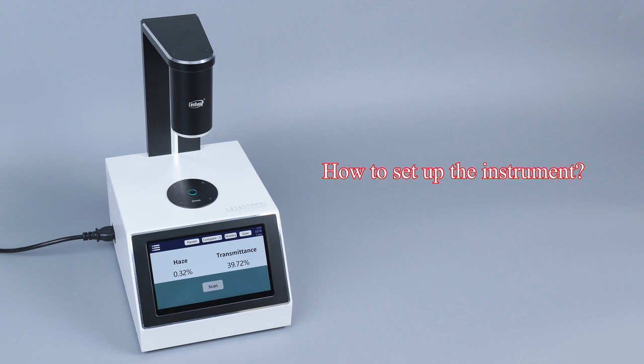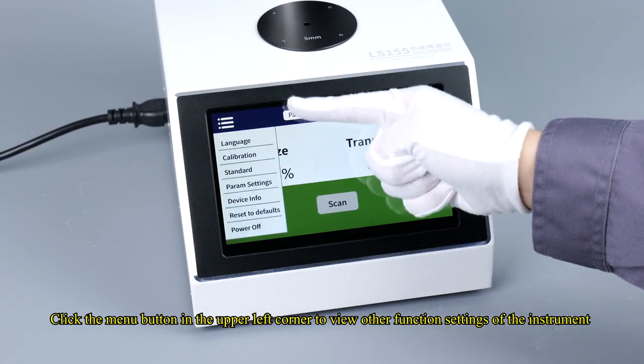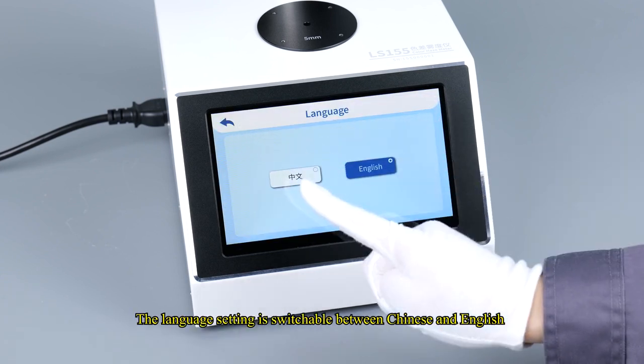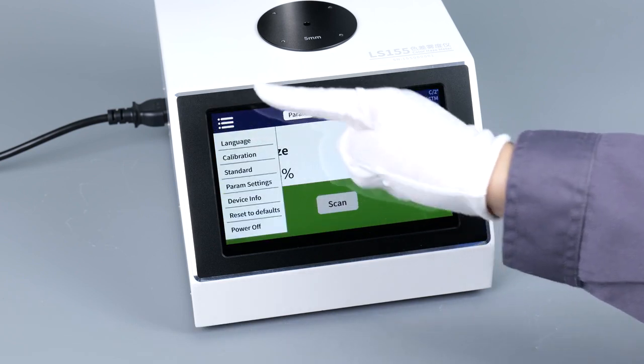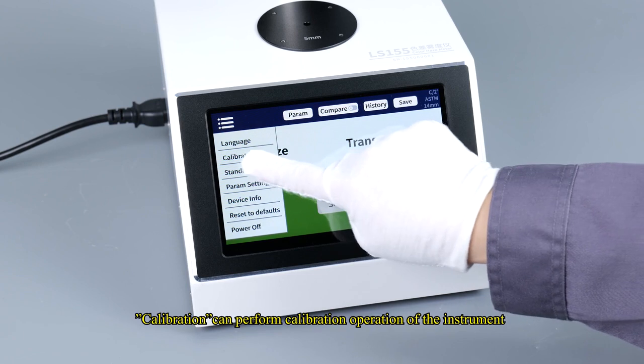How to set up the instrument? Click the menu button in the upper left corner to view other function settings of the instrument. The language setting is switchable between Chinese and English. Calibration can perform calibration operation of the instrument.